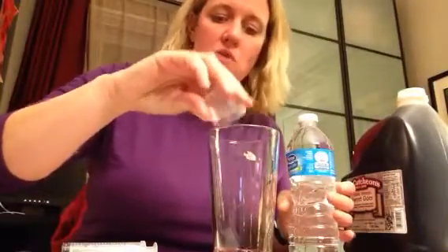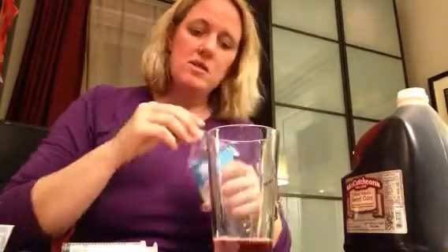Okay, so I got the distilled water in a clear cup. If you're doing a white wine or something that doesn't have a lot of color to it, you do not have to dilute it. When you're doing the dilution, the amount doesn't matter. The only thing that matters in measuring is the amount of juice, the amount of drops, and the amount of solution that you put into it.